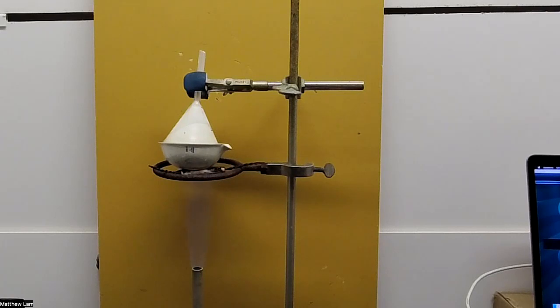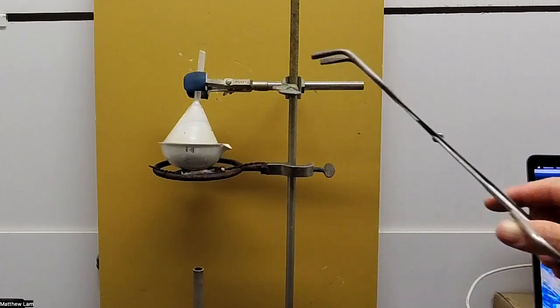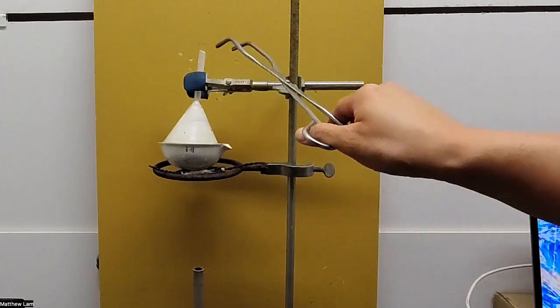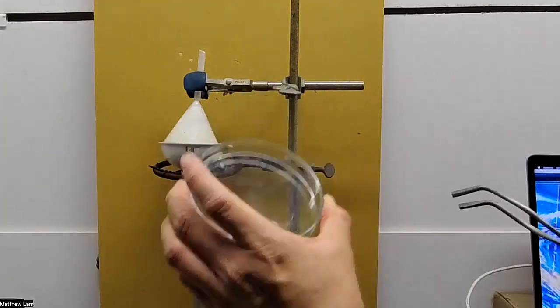Okay, so I think I let it sublime enough. You don't want to let it go too long because then the ammonium chloride will start burning. So I'm going to turn off the gas or the flame on the bottom. And I am going to carefully take that funnel off of the evaporating dish and put it onto my watch glass.